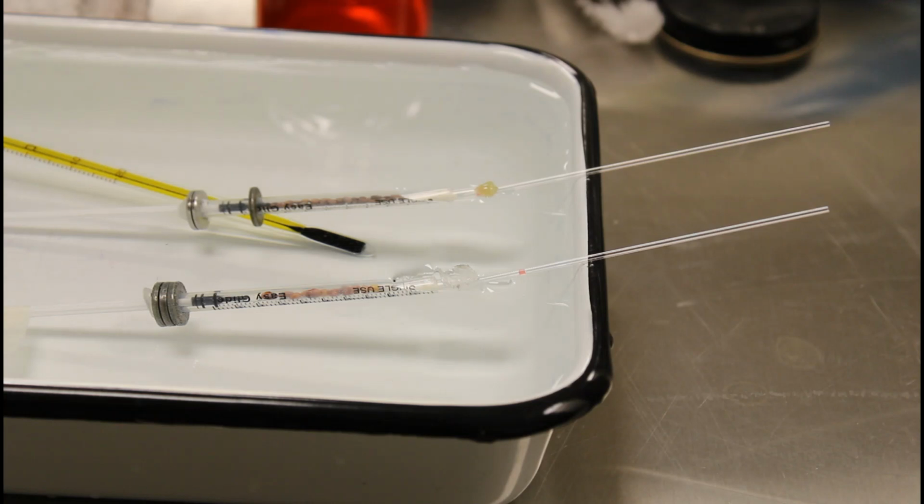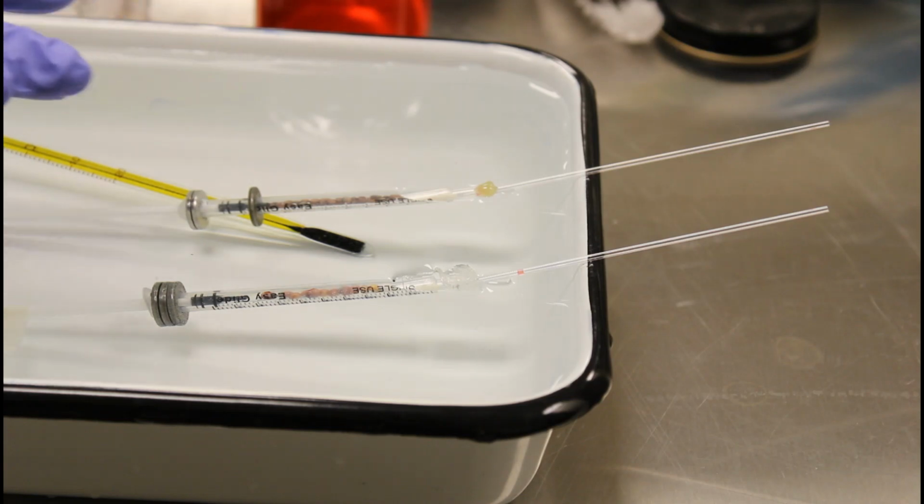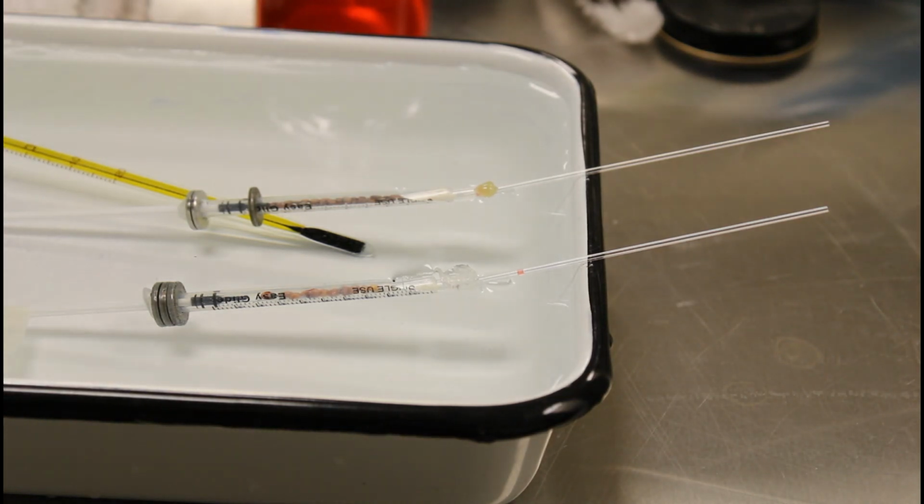All right, so I've actually created 2 respirometers, and they've been sitting in this water bath for about 10 minutes now. And the idea here is to try to stabilize the temperature, and generally temperature is going to be more stable in the water than it is in the air because of the high specific heat of water. So it's more resistant to temperature change. The reason why we want to minimize temperature change is because remember that we're going to be measuring the change of the volume of the gas inside the micro respirometer. We want that change to be due to cellular respiration rather than a change in atmospheric temperature. So we're trying to stabilize the temperature by running our micro respirometers in a water bath.